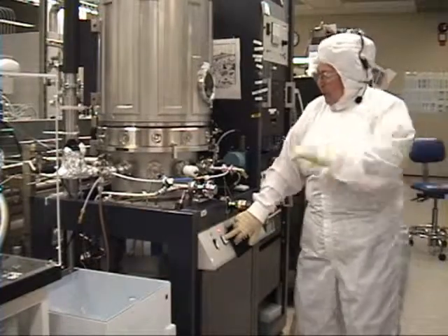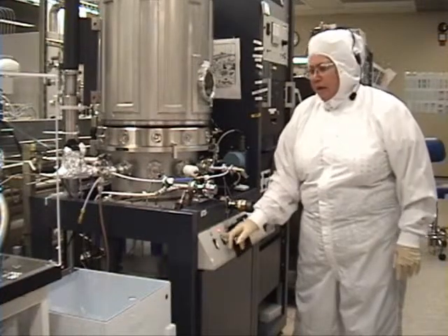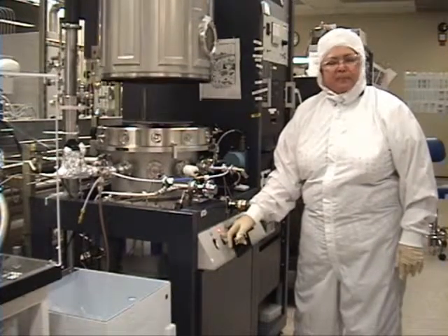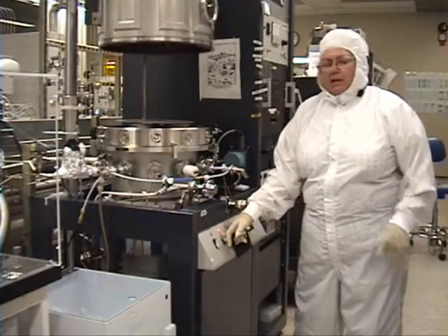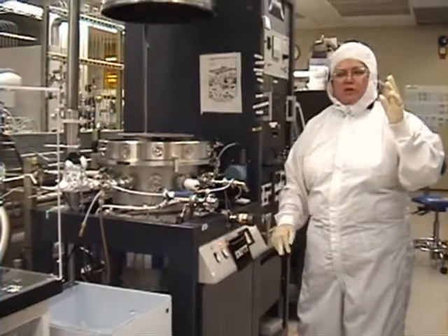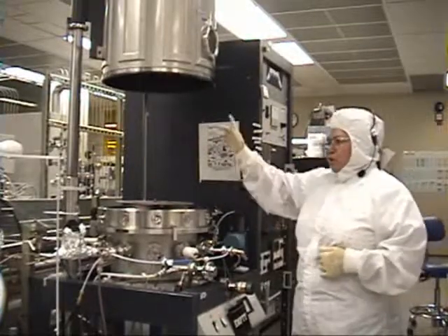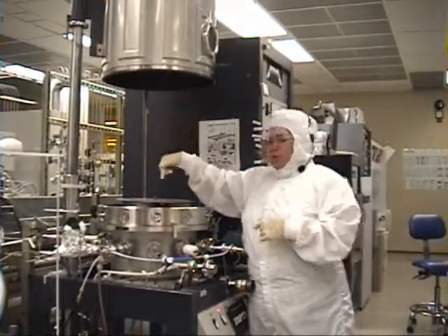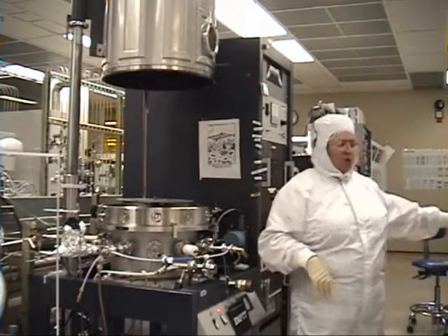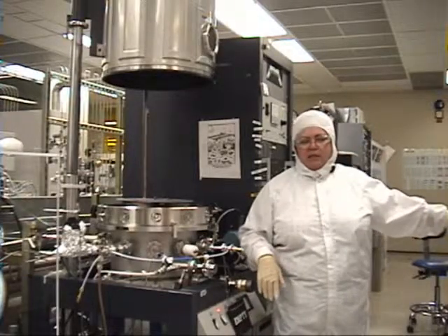Once that's up and you see a decompression, you're going to push the rocker and lift the hoist — the bell jar — up. This bell jar will stop on its own. You can stop it yourself; you don't need to go as high as it goes unless you're super tall. But you're going to do inspections inside, and you're going to remove all the parts onto the table over here with clean wipes.